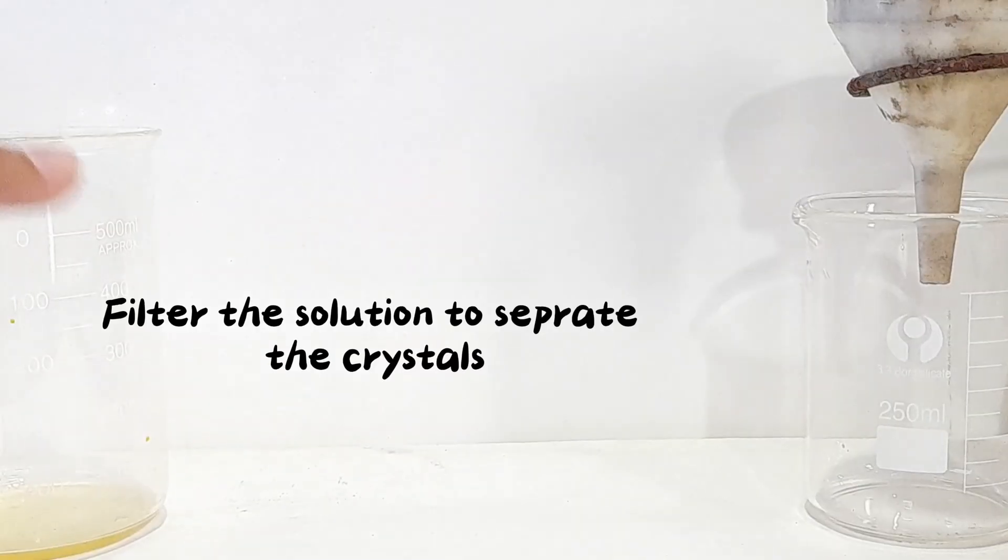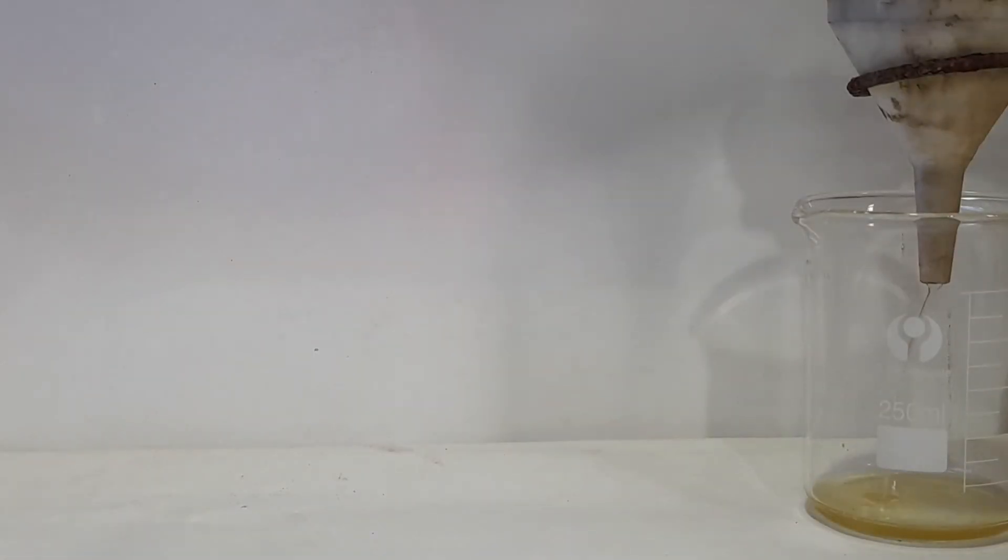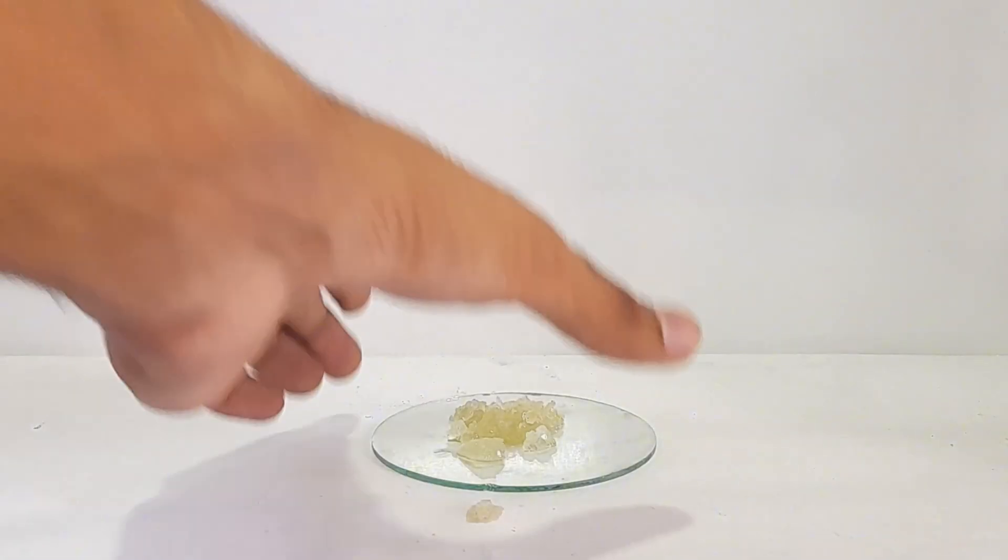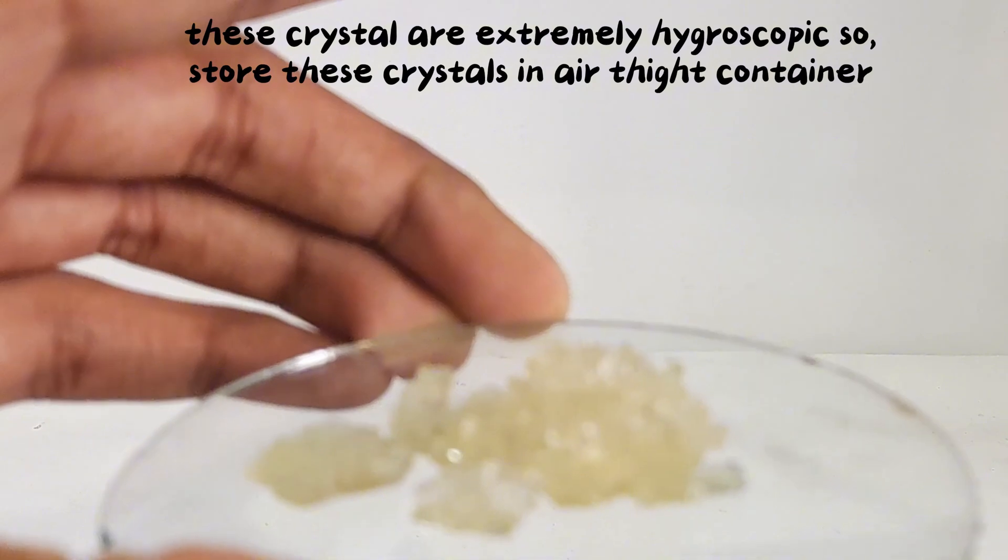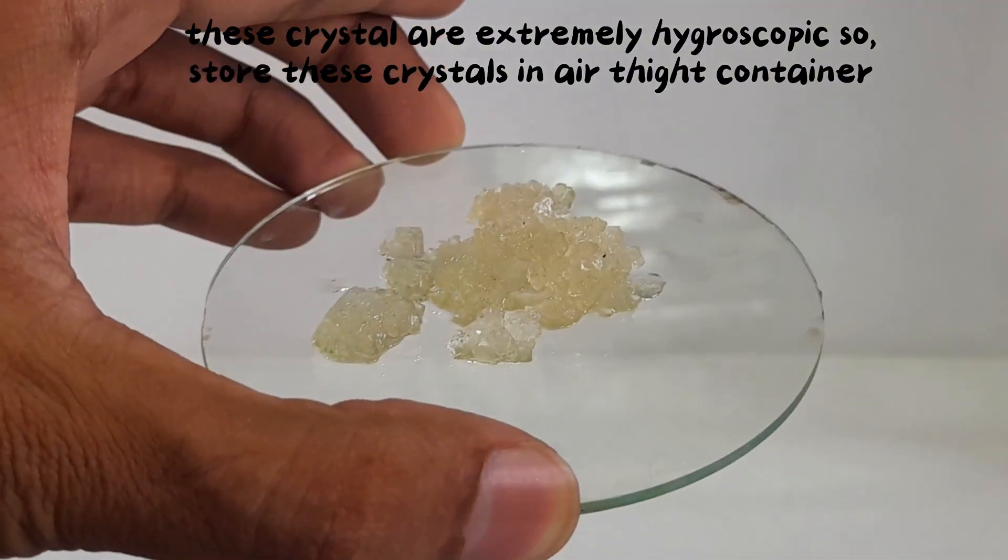Filter the solution 3 times to separate the crystals. One eternity later, these crystals are extremely hygroscopic, so store these crystals in an airtight container.